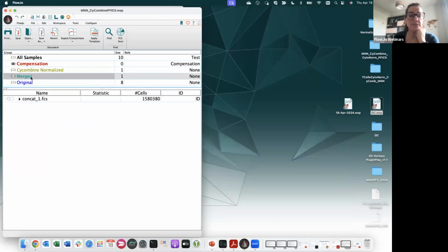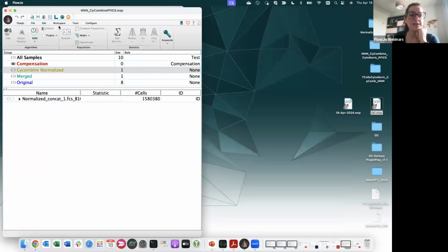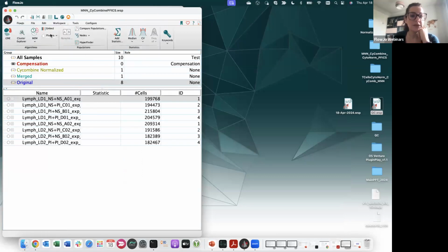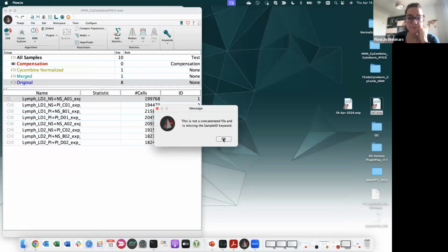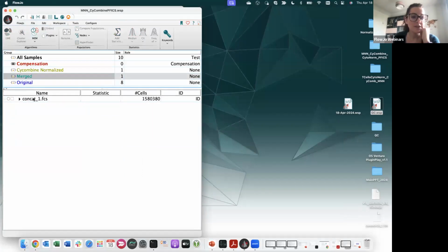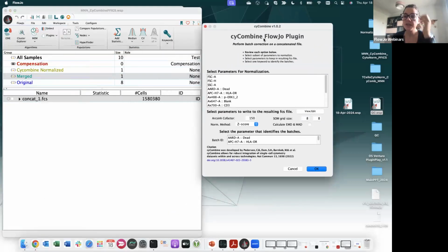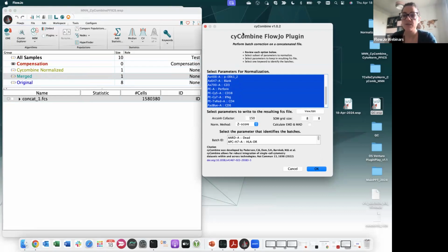Okay, while if you run cycombine, oh, sorry, I didn't show you how to run that. Cycombine, how to run it, okay? It's a standalone plugin, so you will need to download it and install it. So let's say I want to run it. Oops, workspace, plugins. I have it right here, cycombine. Okay, then, which are the markers that you want, the parameters that you want to normalize? Ideally, most of the parameters that you used. Maybe if you cleaned up already, you don't want to normalize those parameters as well.